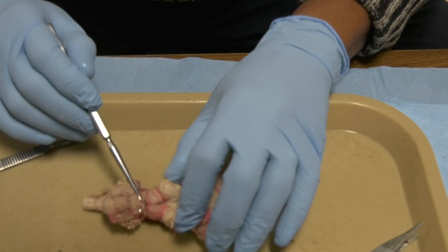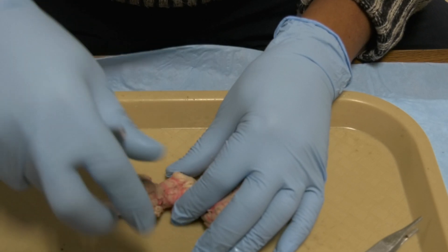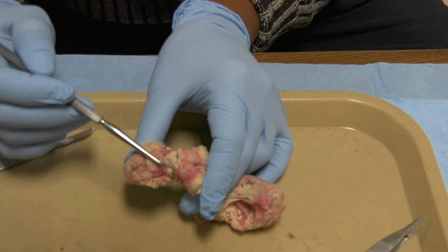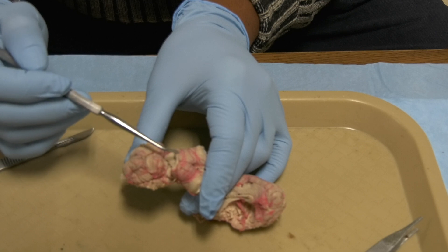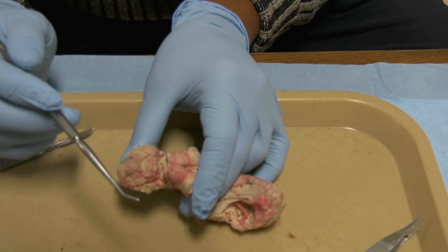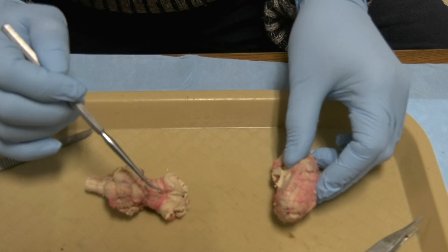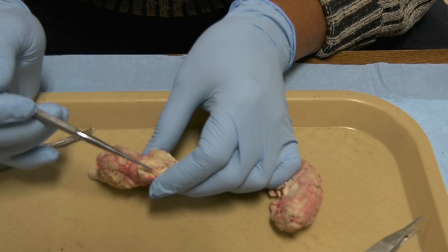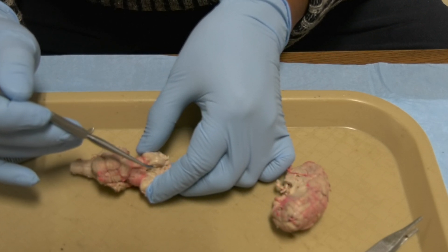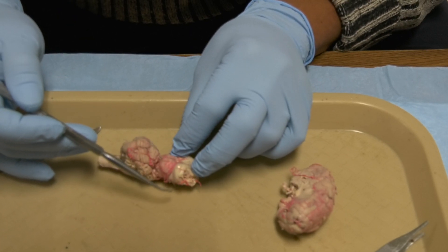Now, this structure here — these two are the rostral colliculi, or the rostral colliculus, and this one here is the caudal colliculus. So these two are the rostral colliculi and these two are the caudal colliculi. Now I completely remove the cerebral hemisphere from the brain stem. This is the rostral colliculus, and this is the optic tract.